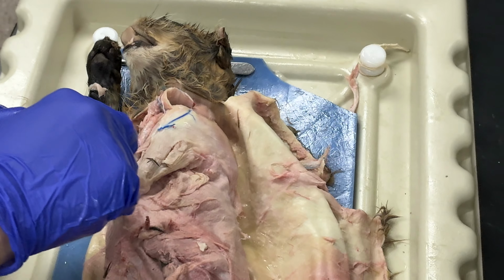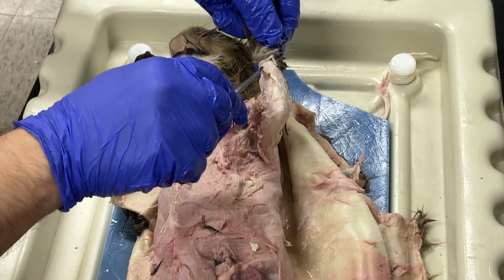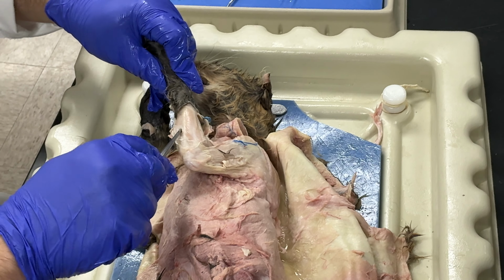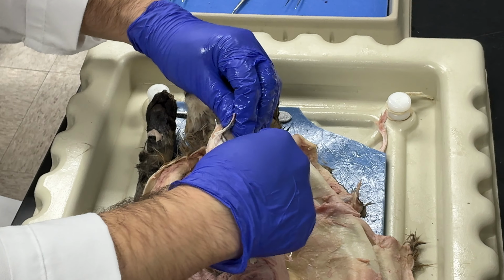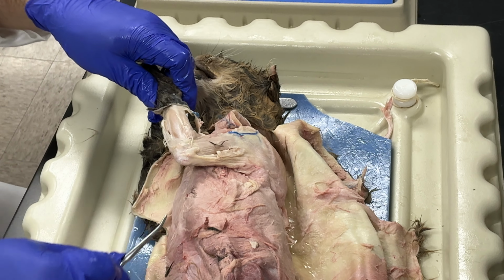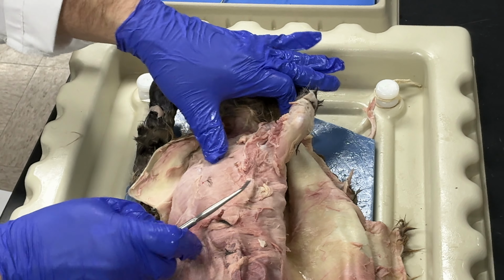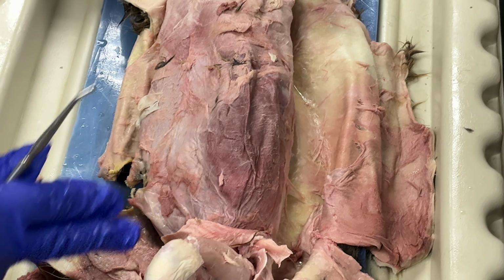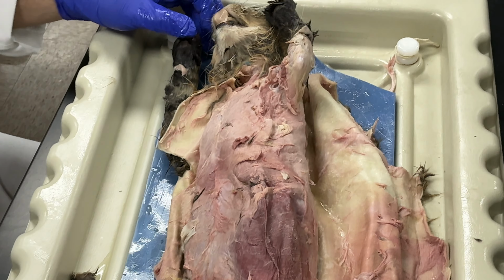This is my brachialis, my palmaris longus, flexor carpi ulnaris, and next to it, my extensor carpi ulnaris. And then again, my pectoralis major, pectoralis minor, rectus abdominis, external oblique. And that's it. All right.